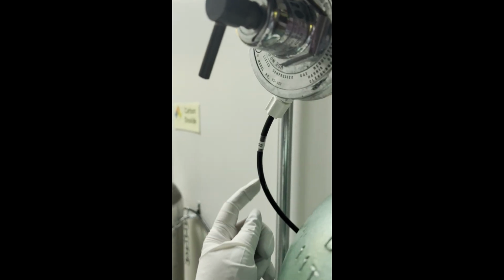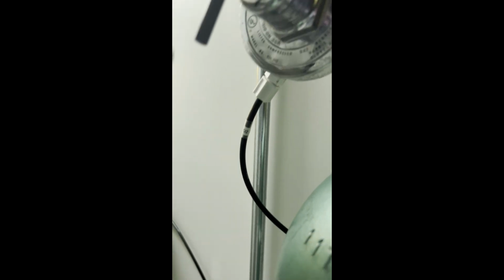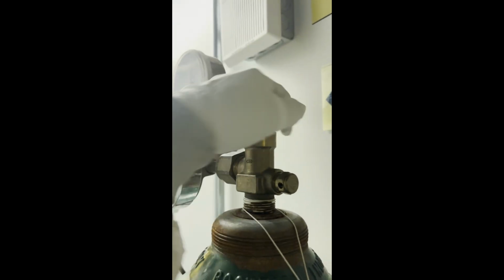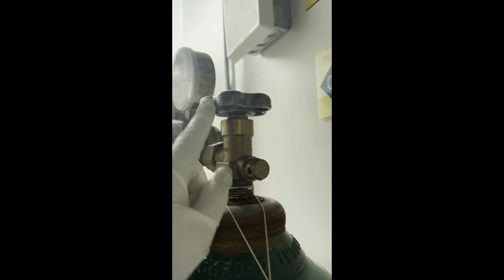This is the tube that plugs into the plasma treatment machine. And again, to close it, make sure it's all the way turned to the right. It's not too tight. You want to allow the next person to be able to open this.